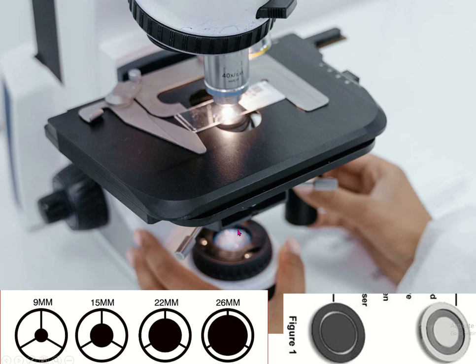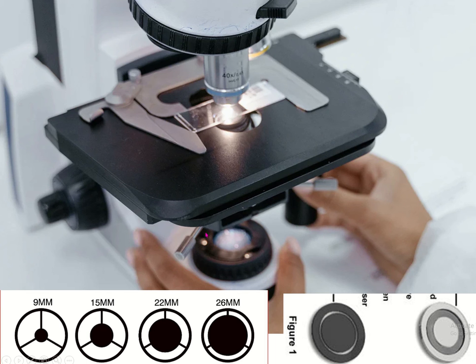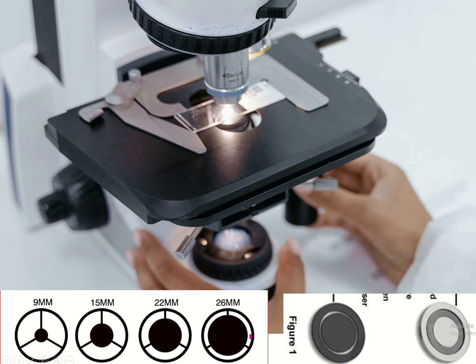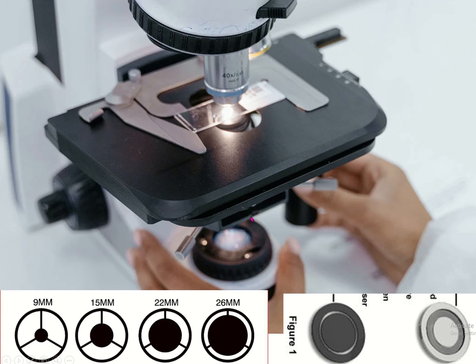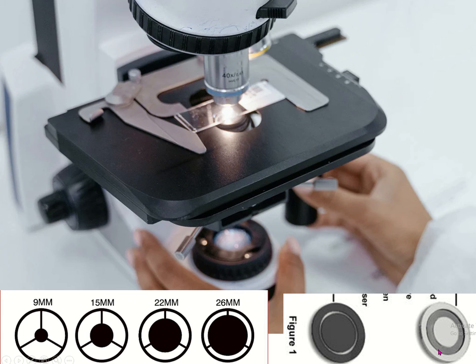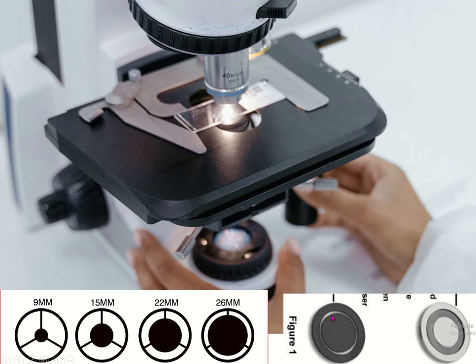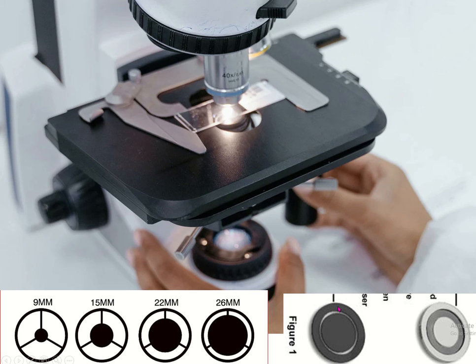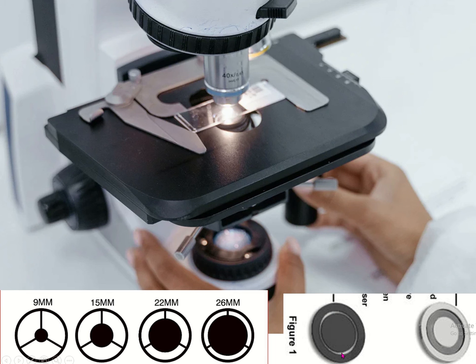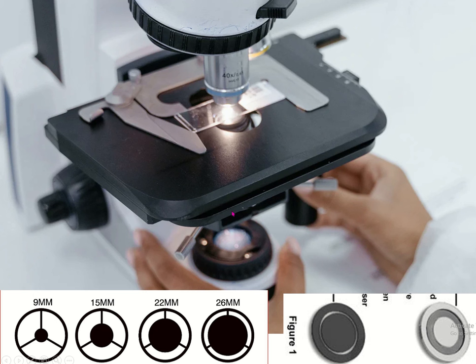This is the covering of the light source. In dark field microscopy, only peripheral light passes through the condenser lens. In phase contrast microscopy, the central and peripheral portions are non-transparent; only the intermediate portion is transparent, and through this transparent portion the light passes through the condenser lens.